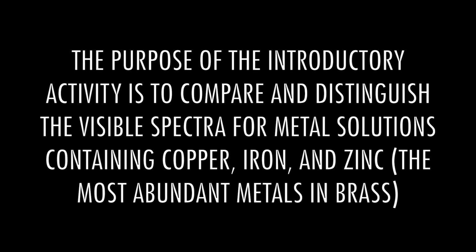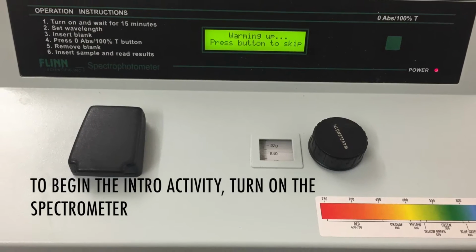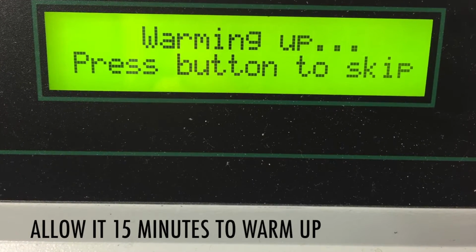The purpose of the introductory activity is to compare and distinguish the visible spectra for metal solutions containing copper, iron, and zinc, the most abundant metals in brass. To begin the intro activity, turn on the spectrometer. Allow it 15 minutes to warm up.